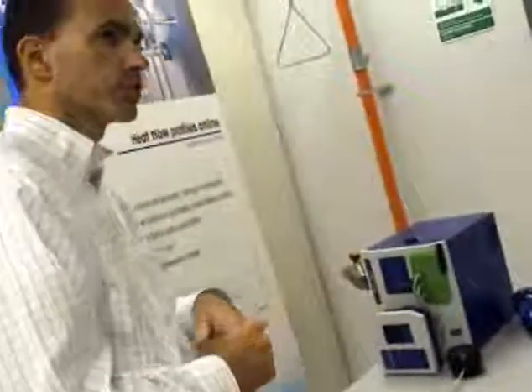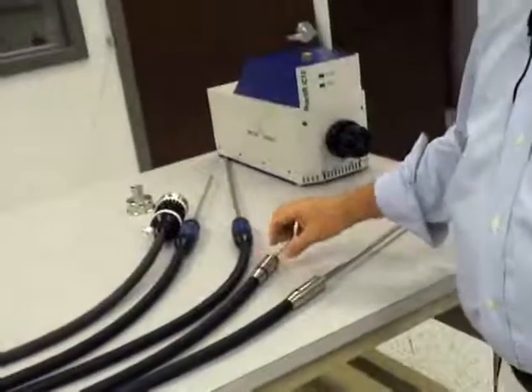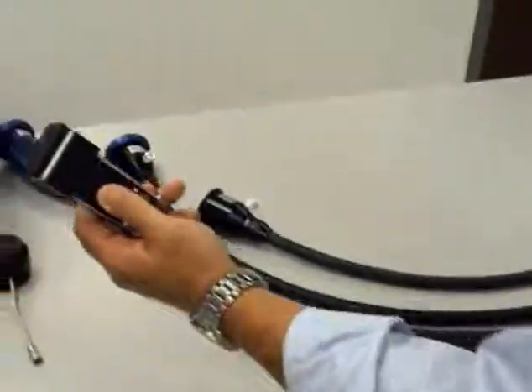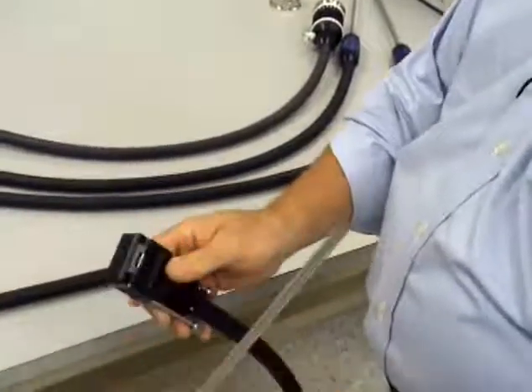How do I connect these to my instrument? That's an excellent question. I'm going to start with what we call the DS series, and this refers to the style of connection that we have here. This is really a plug-and-play, completely pre-aligned optic configuration.